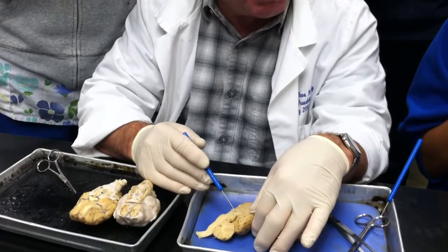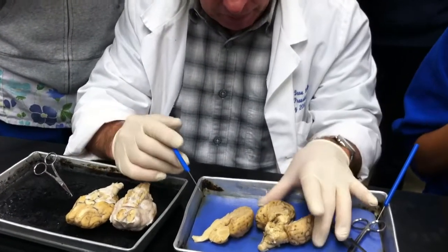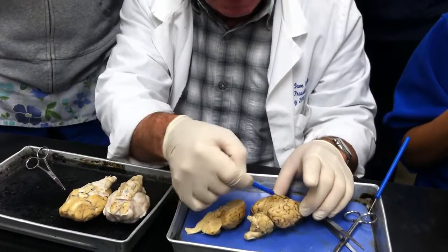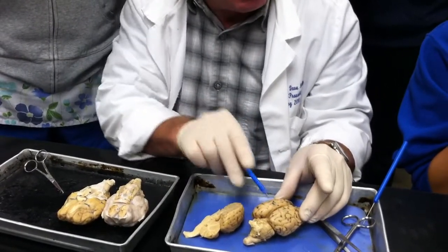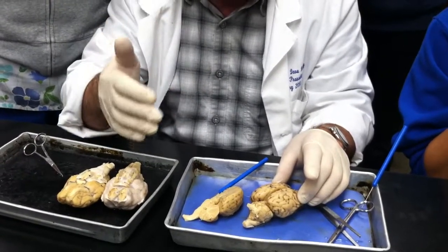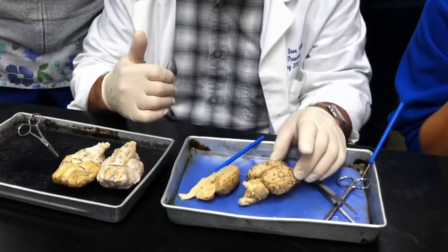The space formed between the walls of the thalamus was the third ventricle. There is a way to demonstrate that. I'll do it one of these nights, where instead of cutting the brain this way, you cut it this way. And so the ventricles appear sequentially, and you can see the third ventricle pretty easily that way. There actually might be some in the bucket in there, and I haven't seen them.